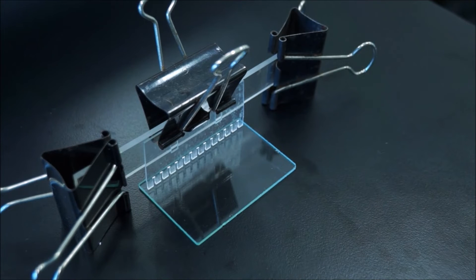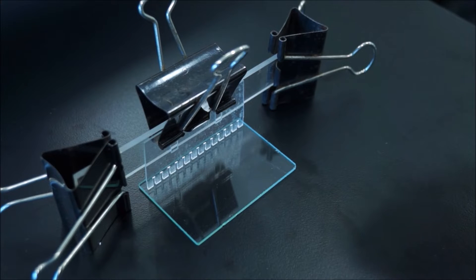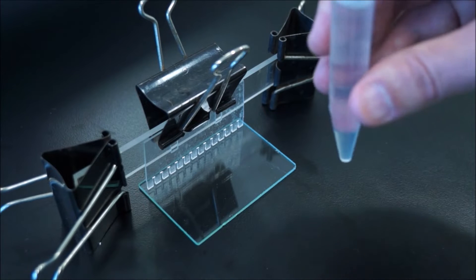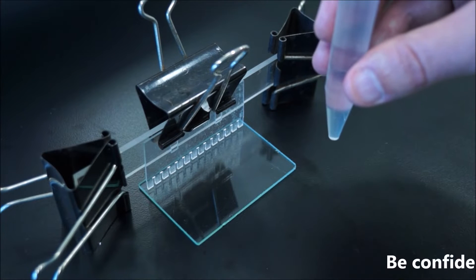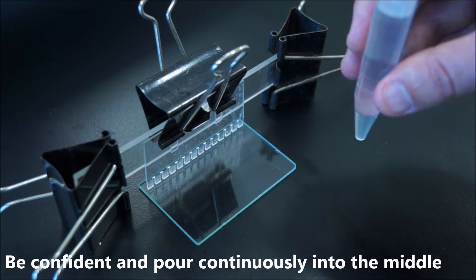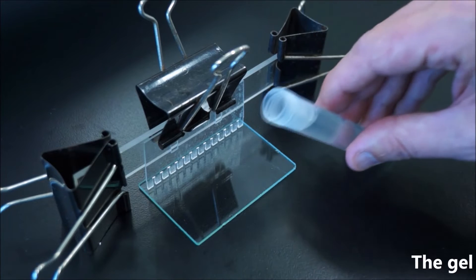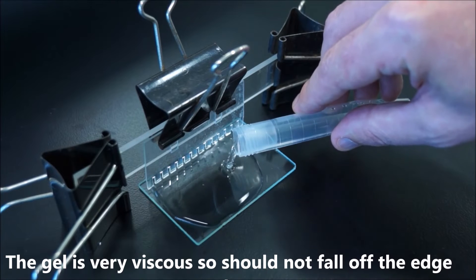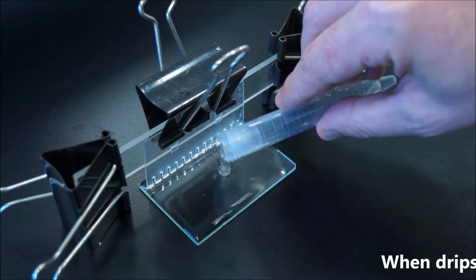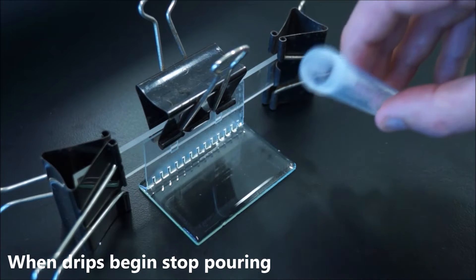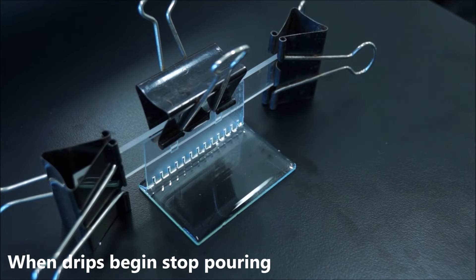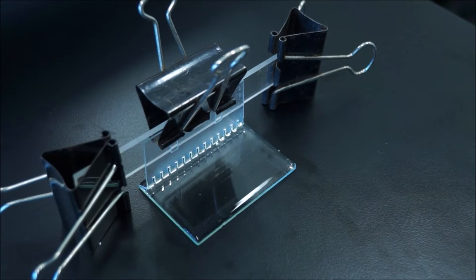Now a lot of people get worried about this, but I wouldn't worry too much because it's quite viscous. It will form up a meniscus as it gets to the edges of the glass plate. All you've got to do is pour confidently and reasonably quickly and keep going. It will keep filling up the edges and won't pour off. You can see it's formed a meniscus at the edge. Don't worry if you get this wrong - we've got plenty of agarose and we can do it again.